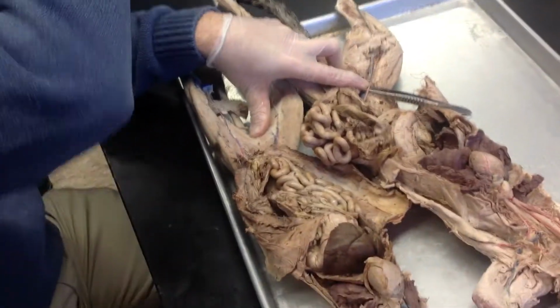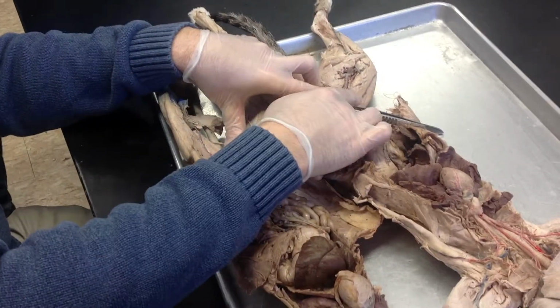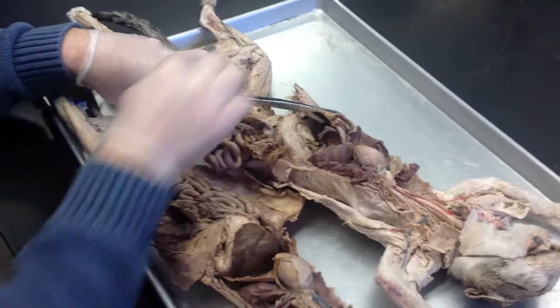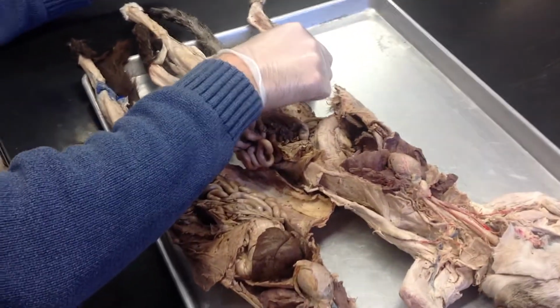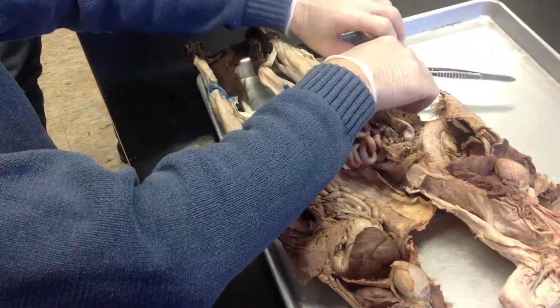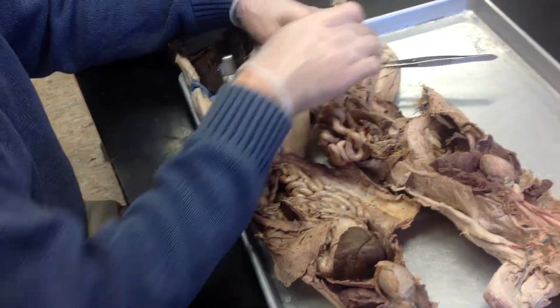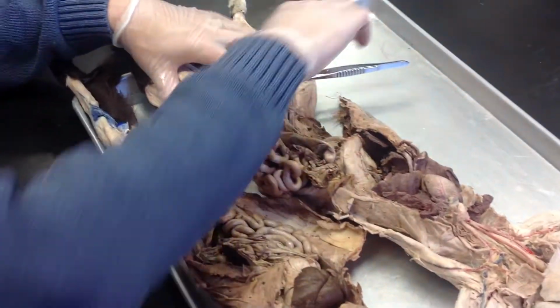That's the position that the external iliac is in humans. So, I'm going to ask it in a way that you shouldn't get confused. There is a difference between humans and cats, but I won't ask you in a way that that's significant. So that's the external iliac. Once we get into the leg, it's called the femoral. Now notice that the femoral artery will take a dive. See? These muscles belong there. But you have to cut through the adductor muscles. This takes a dive and it becomes the popliteal artery and vein behind the knee.